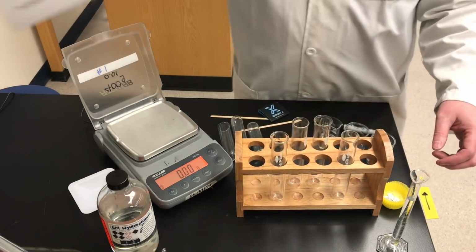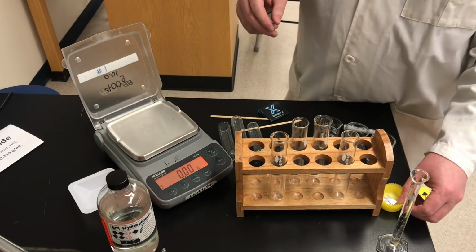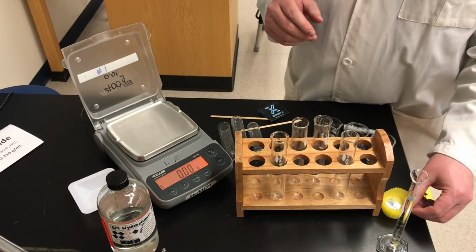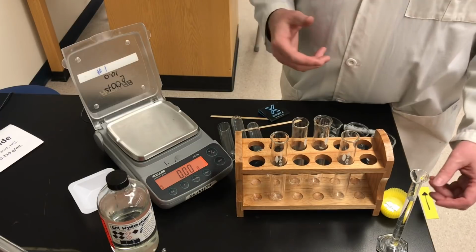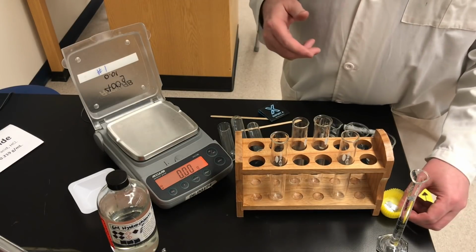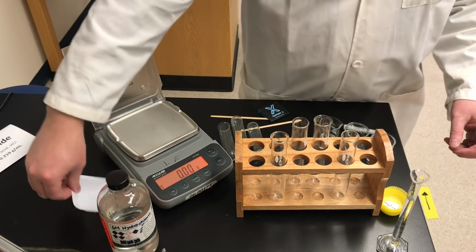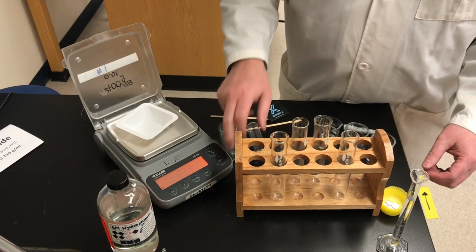So we're going to synthesize zinc chloride in this reaction. Grade 11 chemistry students, you can think about what type of reaction that would be. Zinc metal reacting with hydrochloric acid. You know one product is zinc chloride, but there's going to be another product which a grade 11 student can already predict. So I'm going to take a weighing boat, put that on my balance and zero it.